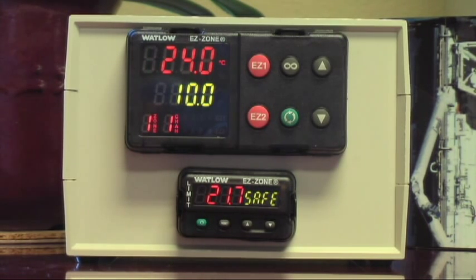It's easy. I know, that's what the controller's called, but I still don't know how to work it. So what I'd like you to do is show me how to use this controller — all I want to do is have this oven heat up to 100 degrees. That's all I want. How do I do that? What's going on here?